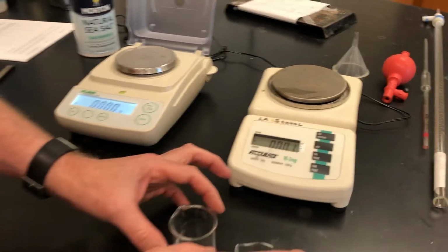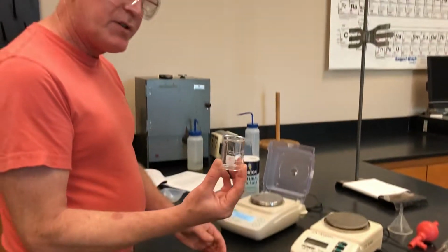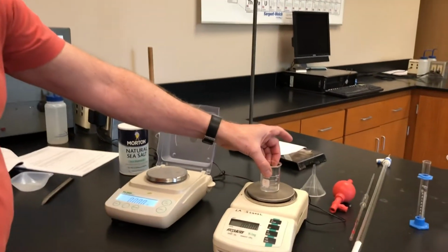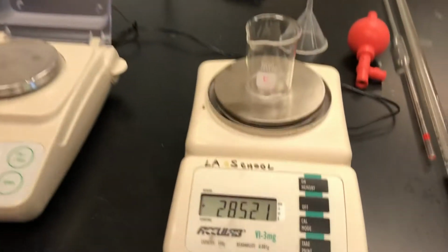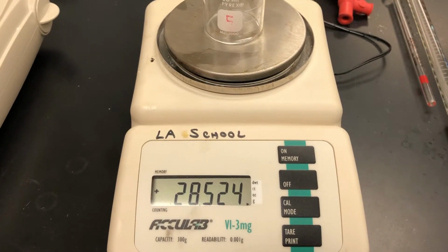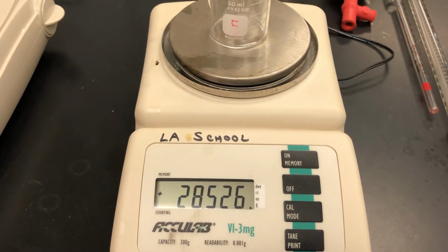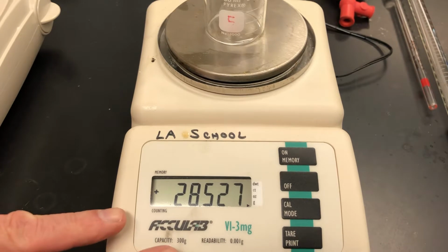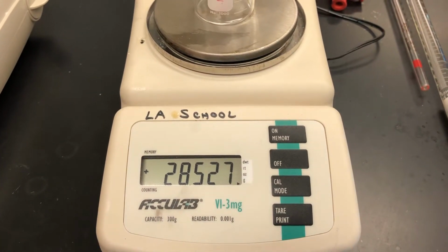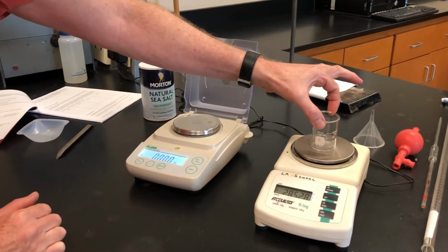But anyway, so we're gonna weigh a beaker, okay? You'll be using these 50 milliliter beakers quite often. So I'm gonna put it on one electronic balance, and this is what it weighs. I believe you are supposed to record this value in your lab manual. You may even want to write down exactly what electronic balance that you used. And now what I'm going to do is come over to this electronic balance and we'll weigh it on it.